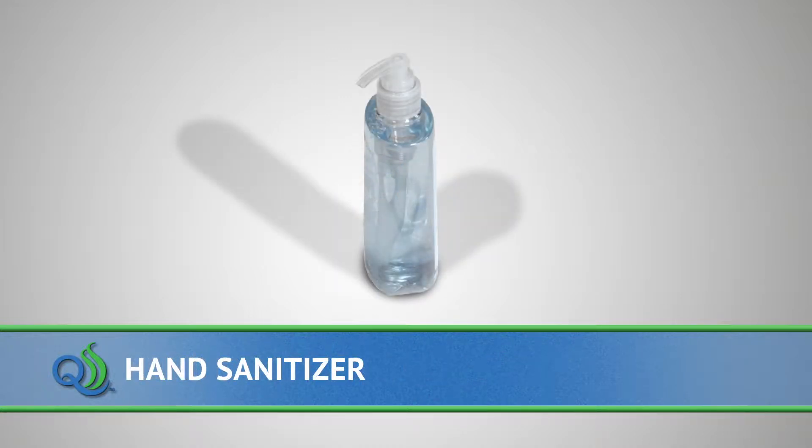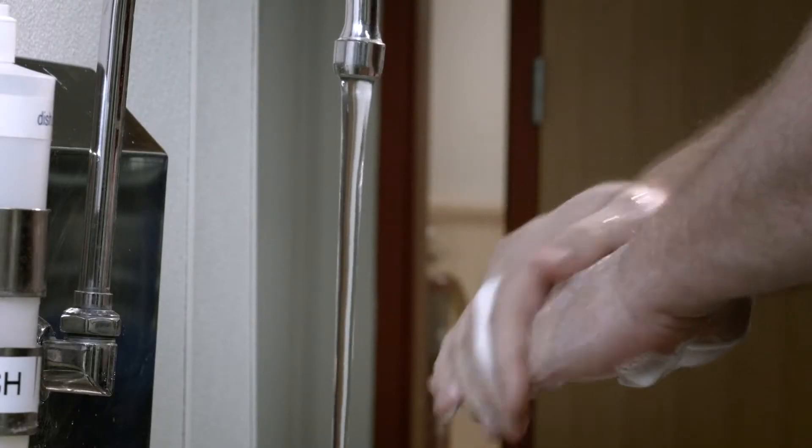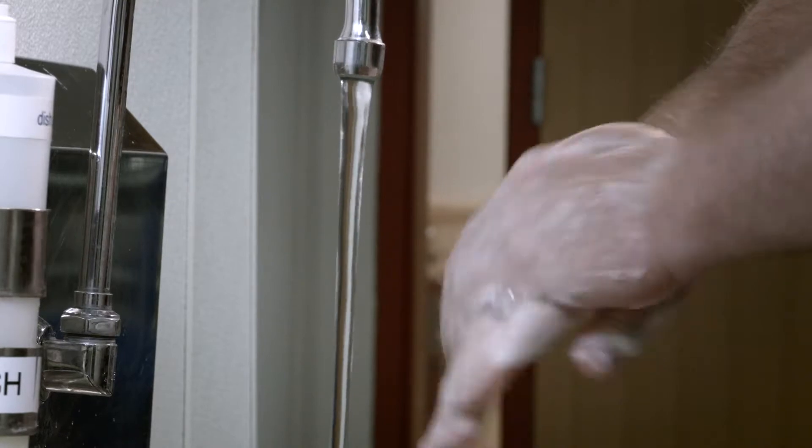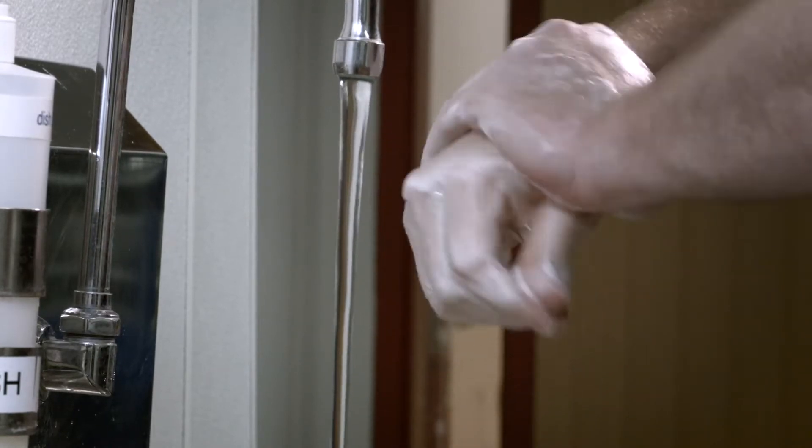and hand sanitizer to clean hands before sampling. To begin, wash hands thoroughly prior to putting on personal protective gear and disposable gloves.